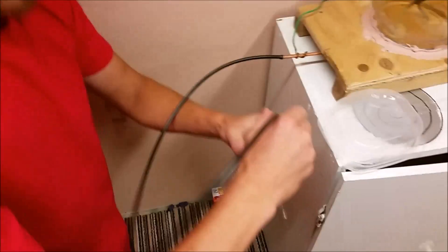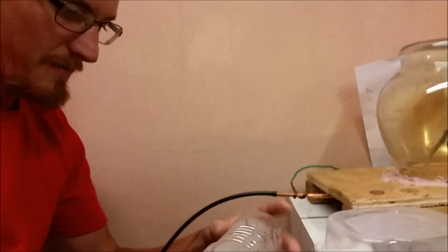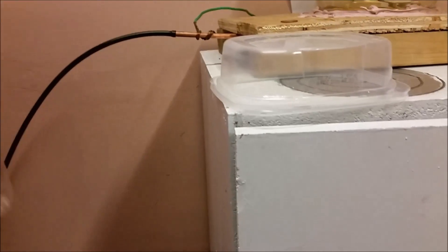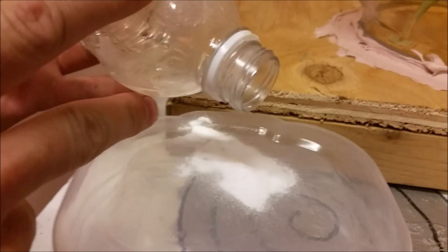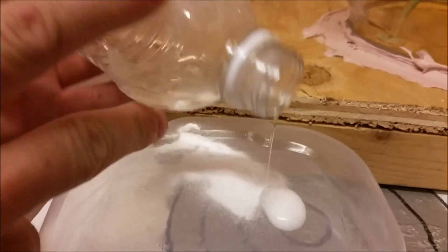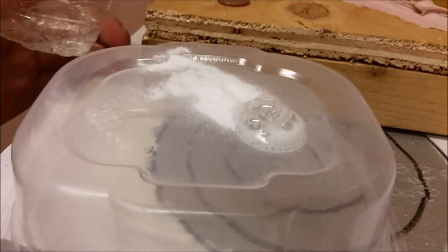Let's open up our bottle with the acid. Now these water droplets on the side probably contain more acid than anything. Let's wash those down into there. A little bit of baking soda. See if this reacts to the baking soda. It's definitely acidic.